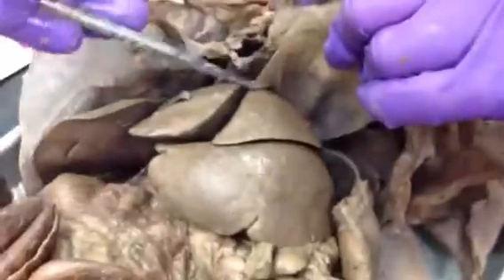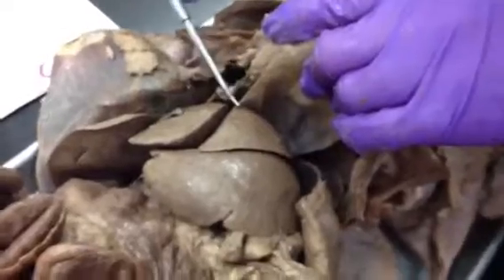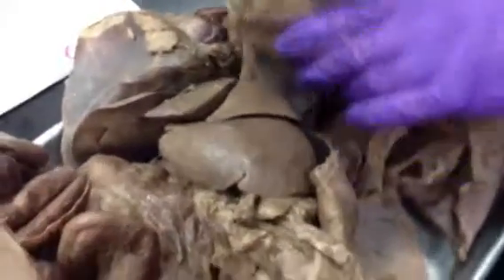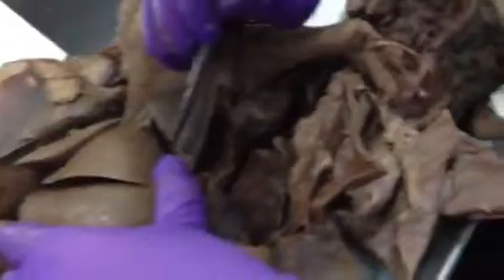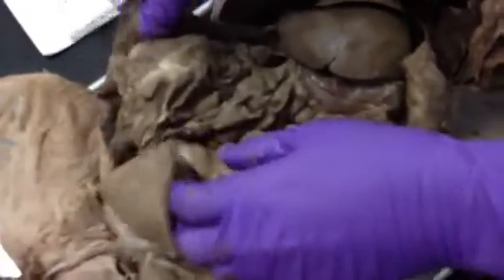And then another example of a ventral mesentery is the falciform ligament, which is here. And if it's rounded, the rounded edge is the round ligament of the liver. And then the coronary ligament is very thin, and it's between the liver and the diaphragm. And if the mesentery, the greater omentum, surrounds the intestines completely, it's called an omental bursa. That's just another word for it draping over.